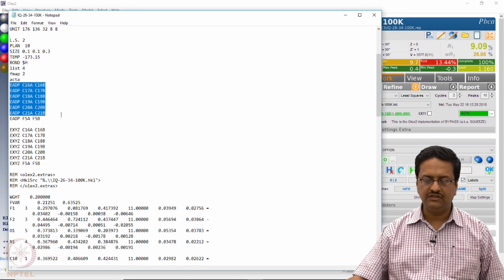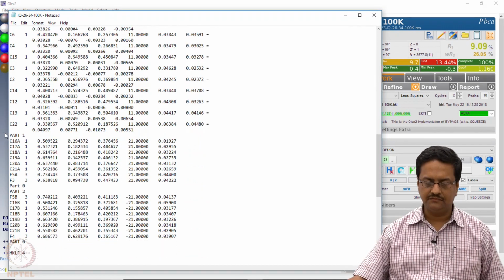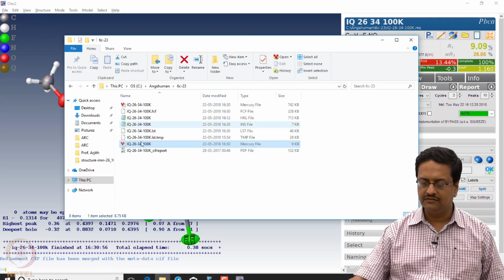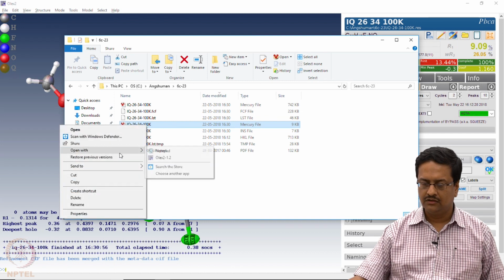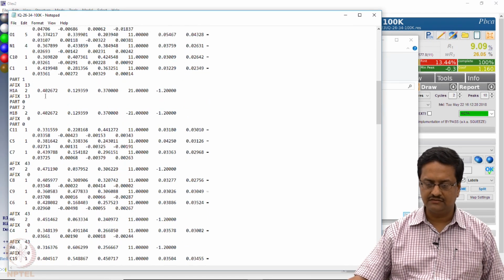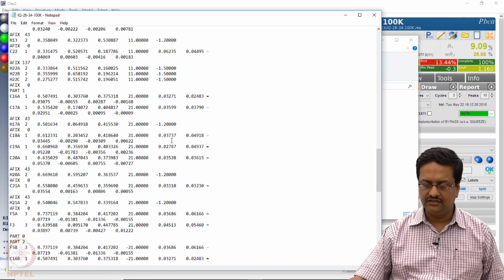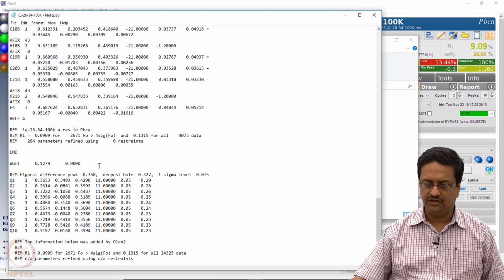See, this is how the EADPs are written, this is how the EXYZs are written, and then we have two parts which are disordered. So now if I try to open the RES file, which now will have the disordered sections again segregated, but now with the corresponding hydrogens, and you can see these 21 and minus 21, they have the anisotropic thermal parameters associated with it, and the structure is complete.